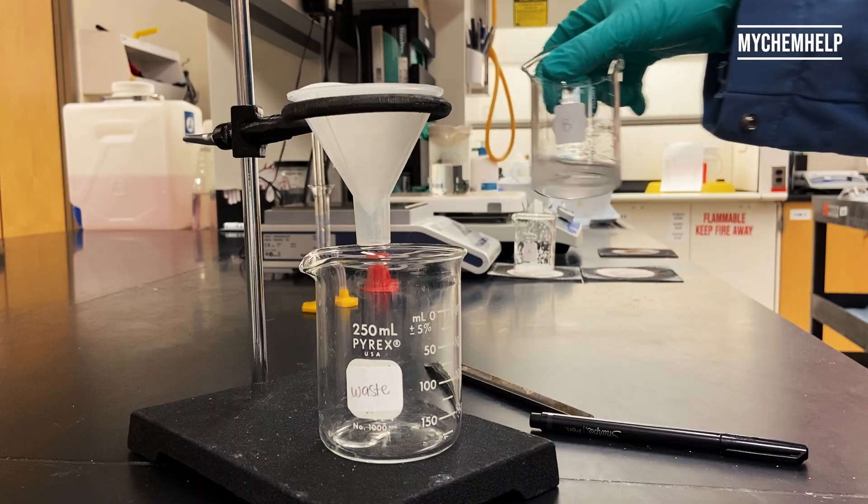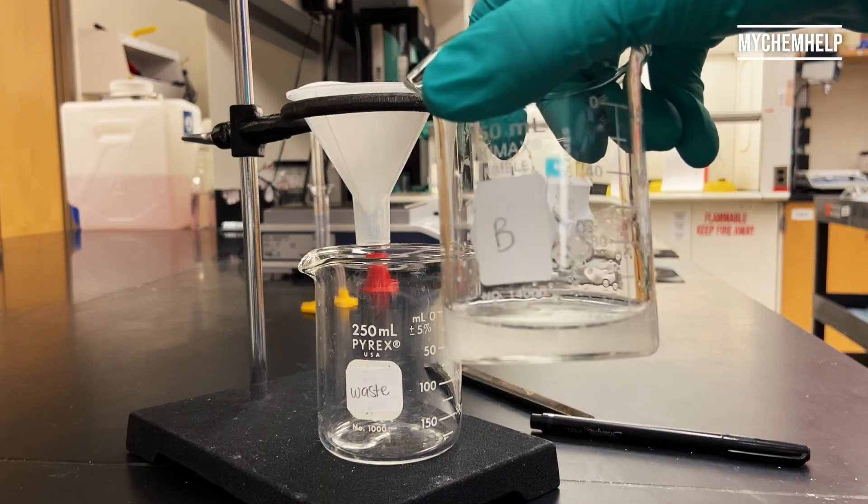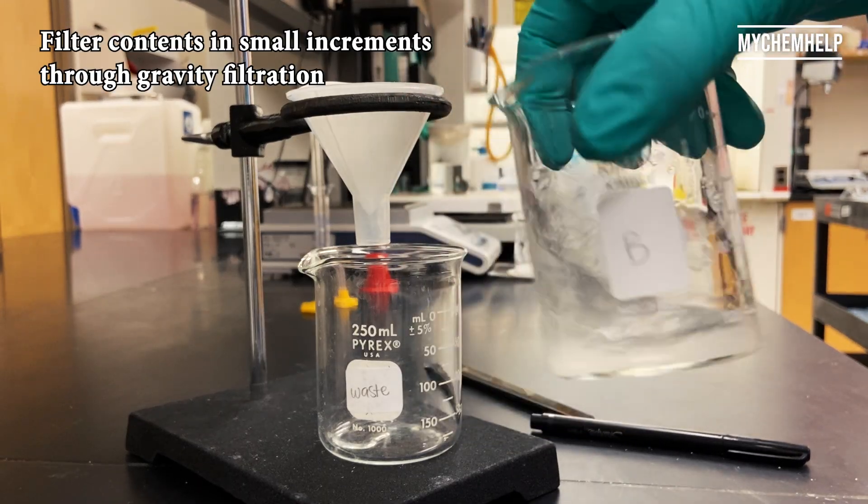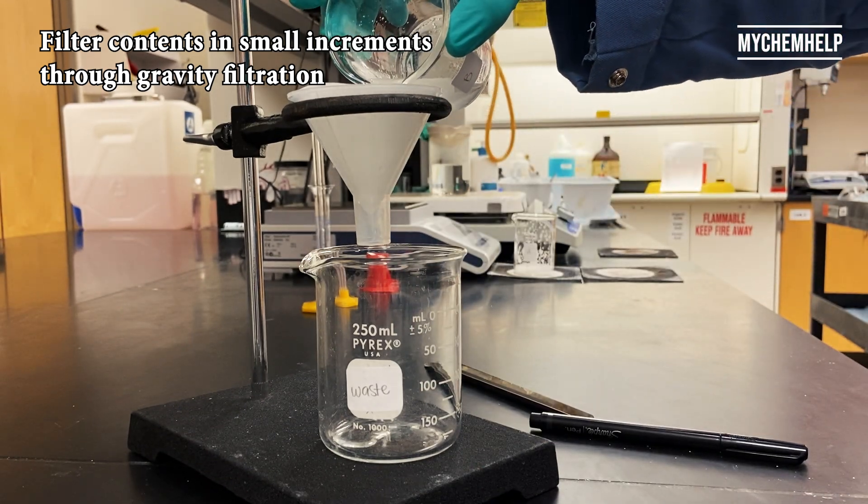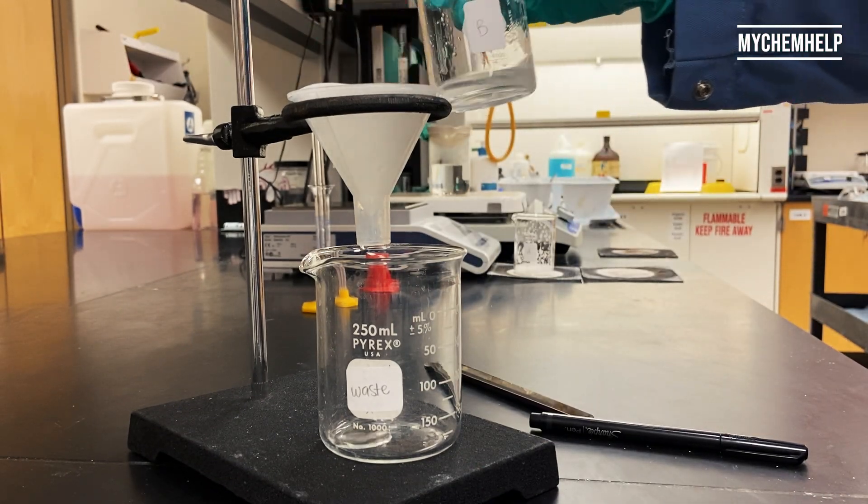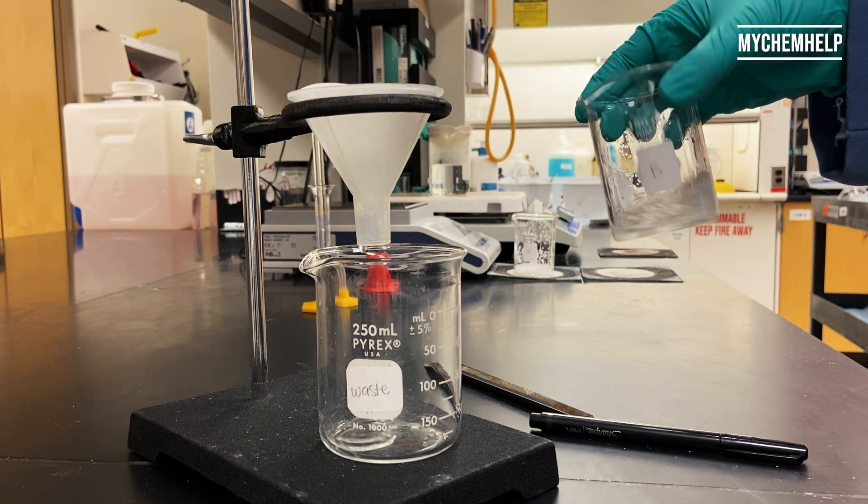So the contents of beaker B, I'm going to filter through gravity filtration, another method of our physical separation. And this will take quite a while, so I won't bore you with the whole process.